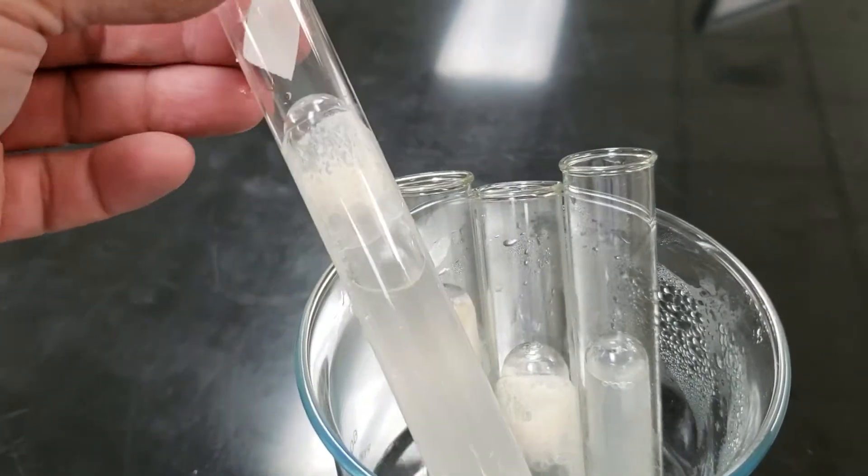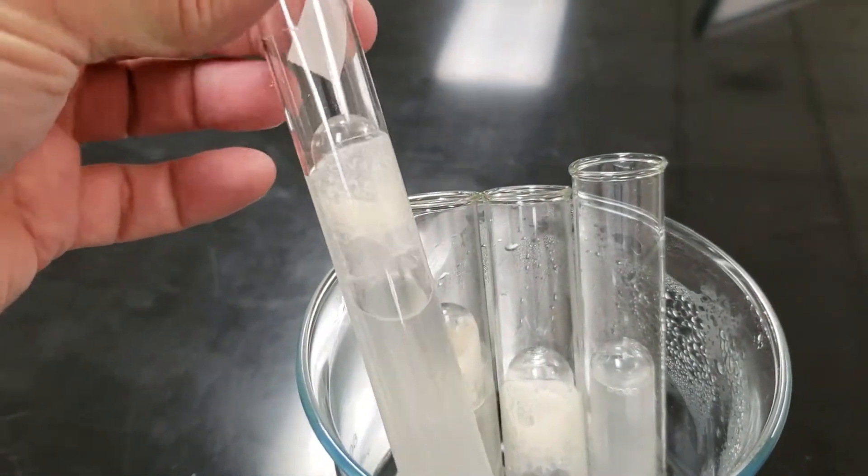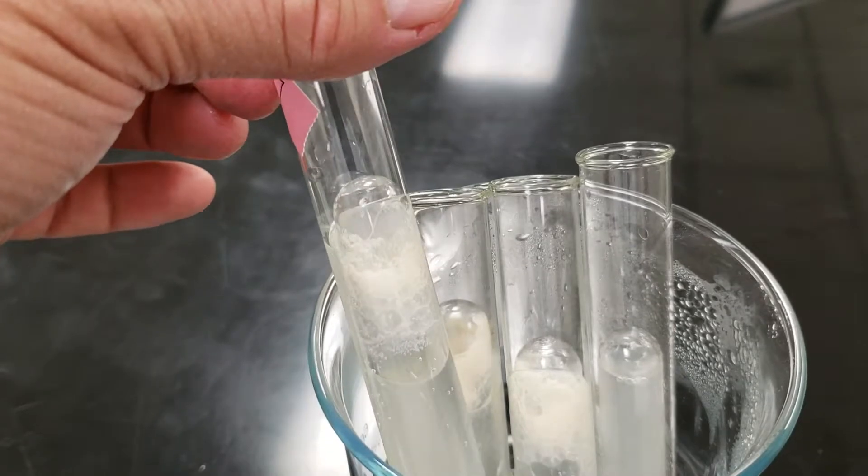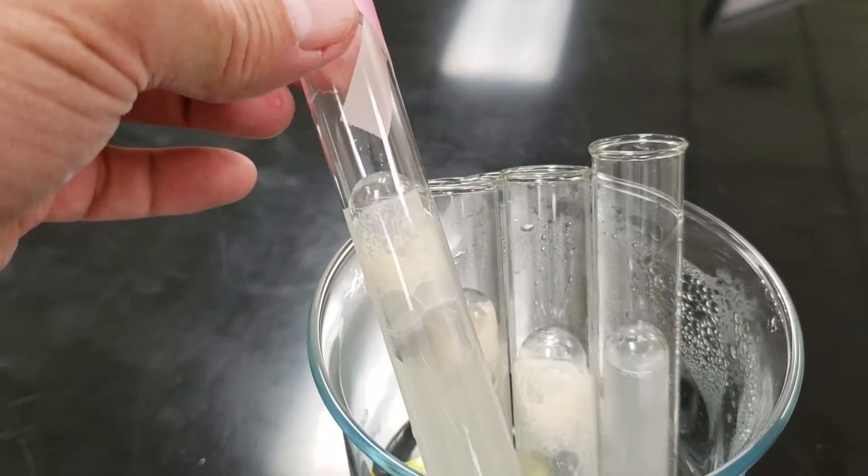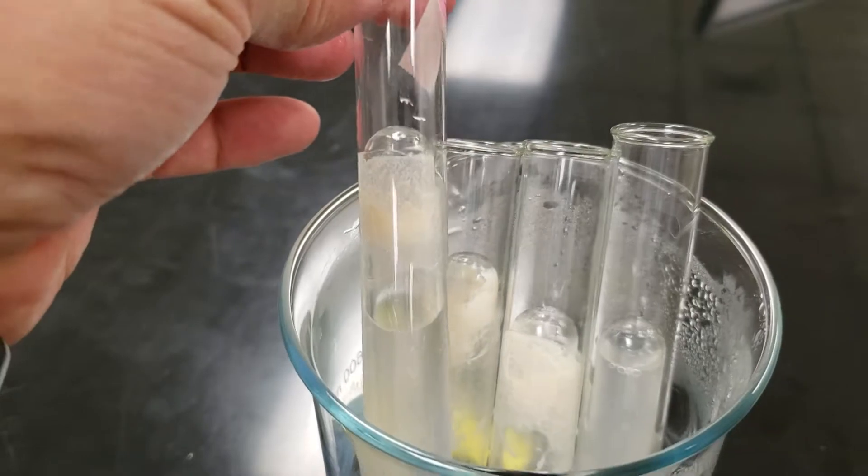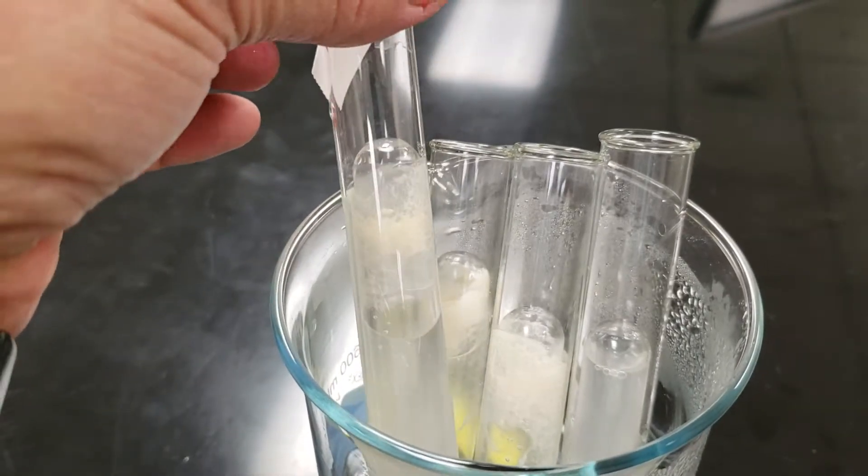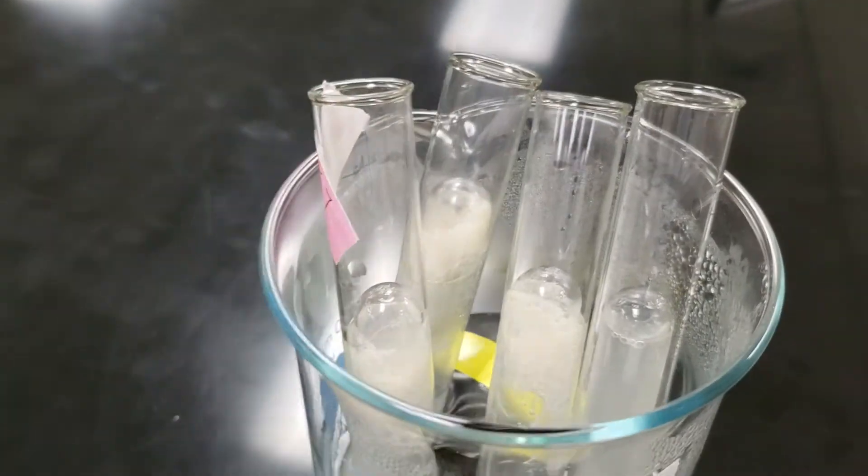So we showed fermentation and carbon dioxide production with sucrose and yeast.